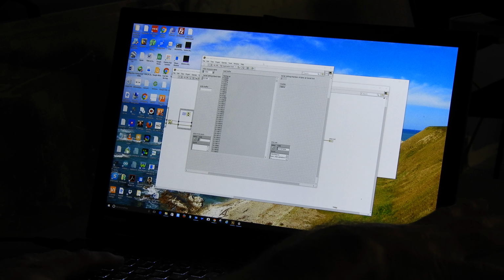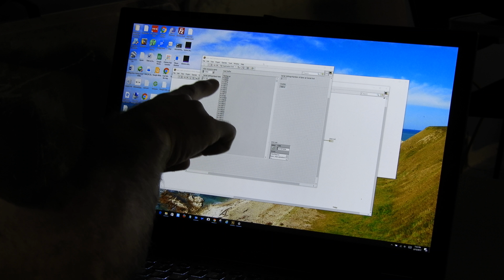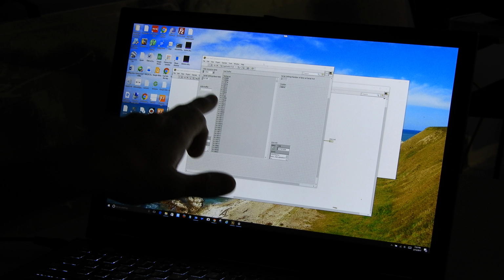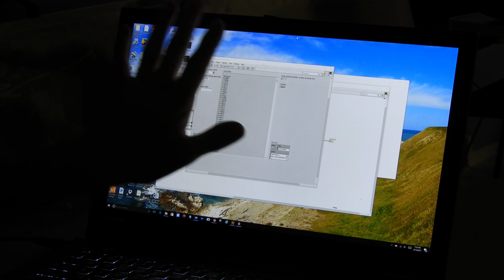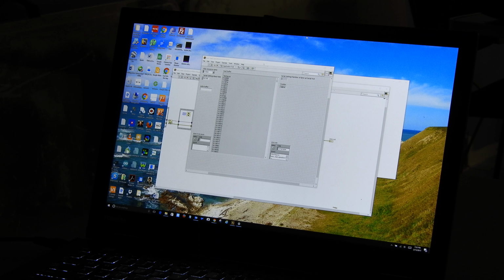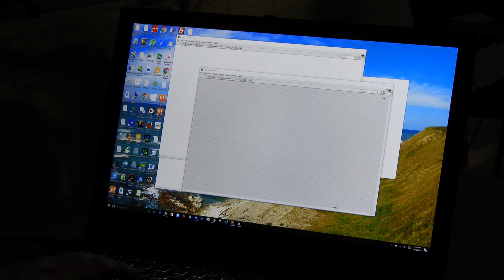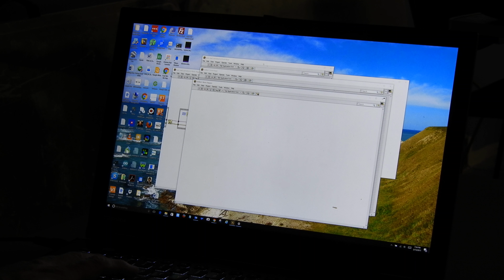Now, I don't have the thing connected right now, so I'm going to take the digits that were recorded here, and I'm going to make a graphing function just using this data right here, and then I'll apply it once I'm connected to the actual CCD. The way that I would do that is I'm going to go over here to File and say New VI. So once I've selected New VI, I have an untitled 2.vi that's opened.